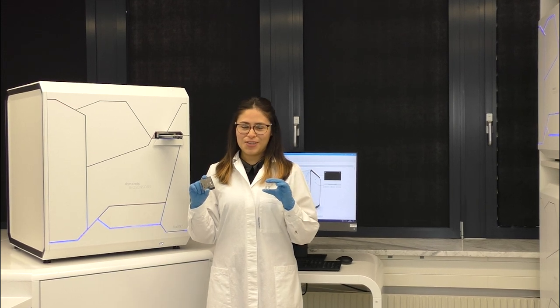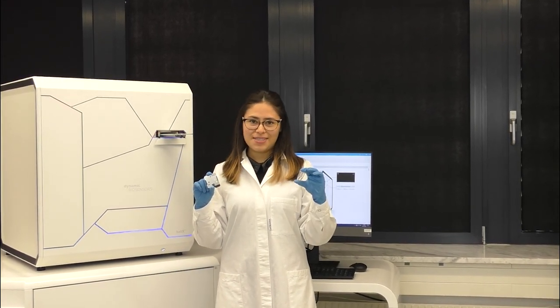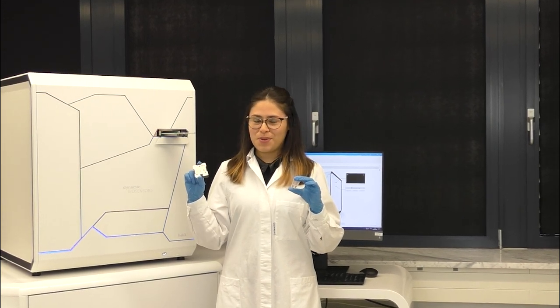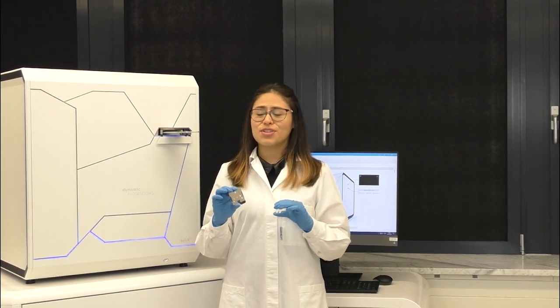So let's get started. Here we have everything we need to carry out our measurements. Firstly, the samples we would like to analyze. Secondly, the Helix biosensor chip. And finally, the Helix instrument itself. So let's have a closer look at them.